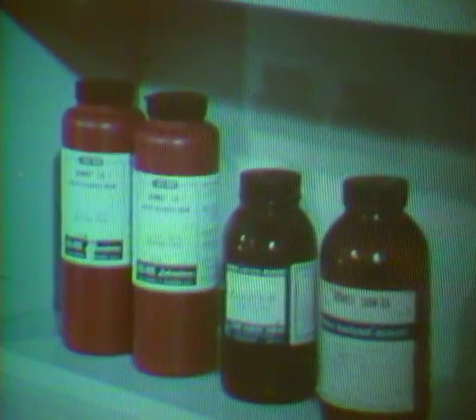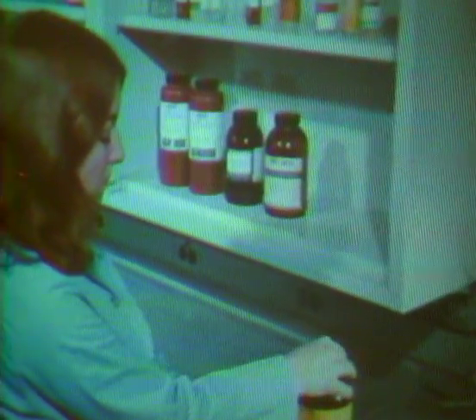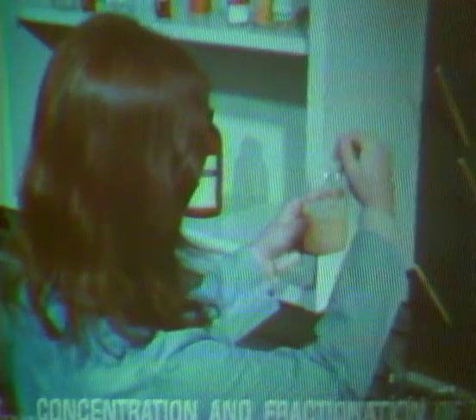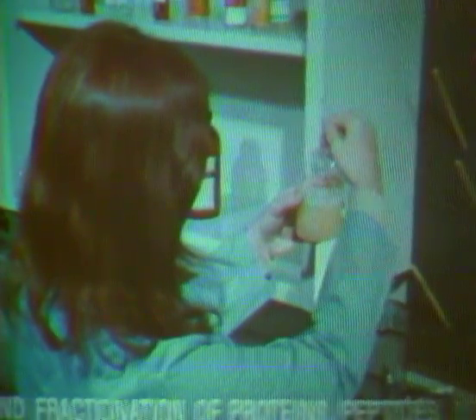The smaller particles penetrate the pores and partition with the solvent inside, and thus are retarded by the gel and therefore elute later. Since large molecules cannot enter the pores, they are not retarded and are eluted rapidly. There are a number of commercially produced gels available in various molecular weight exclusion capabilities. Gel filtration finds applications in desalting of macromolecules and in concentration and fractionation of a wide variety of substances.